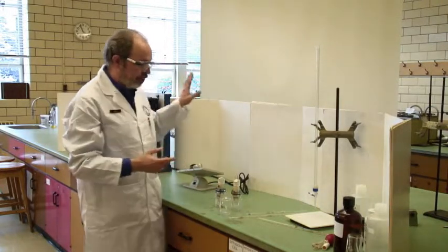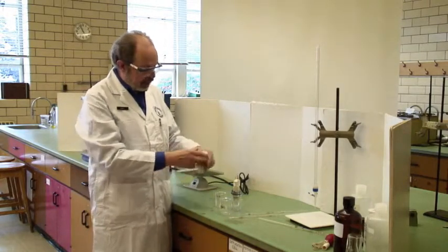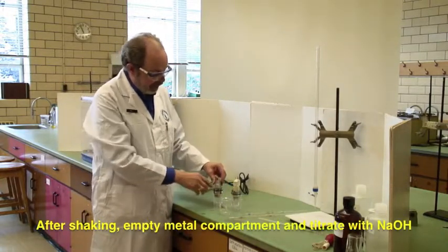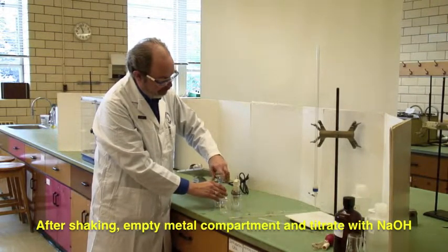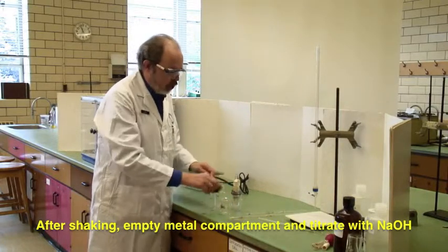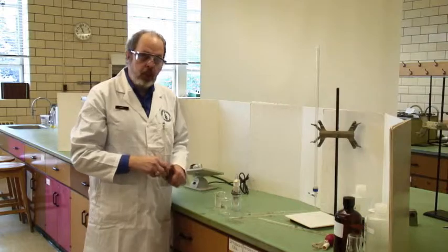Once you take it off the agitation device, put it in with the acid side down and the metal side up, open the lid, and pour the contents directly into a beaker. That is going to be what you titrate.